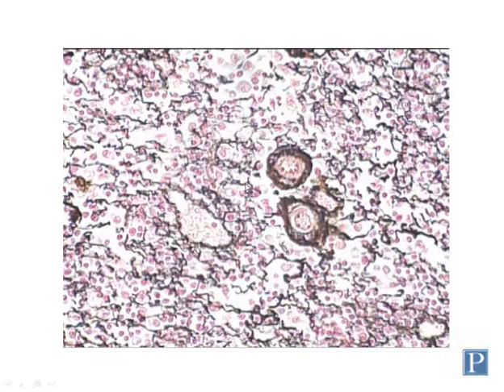So this section has been silver stained, and silver stain shows the reticular fibers and stains them kind of a blue-black color. Notice they tend to be short, often branching, and they have this kind of mesh or net-like appearance, which is where reticular fibers get their name. So this is reticular connective tissue. You can see a couple of blood vessels here that have taken up some background staining. So it's these fibers here that you want to look at.